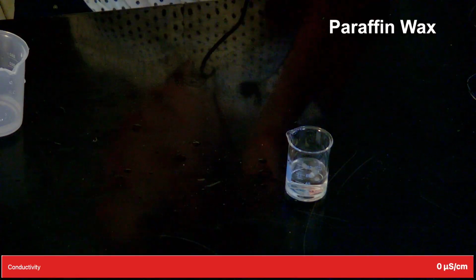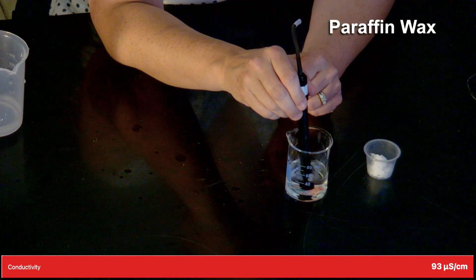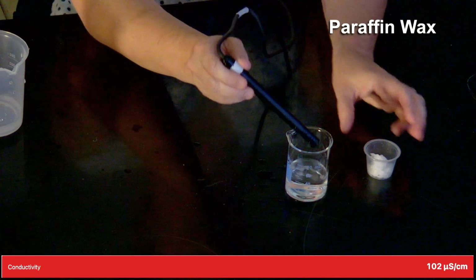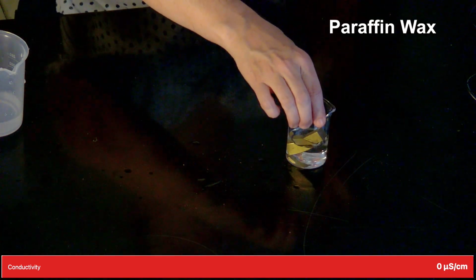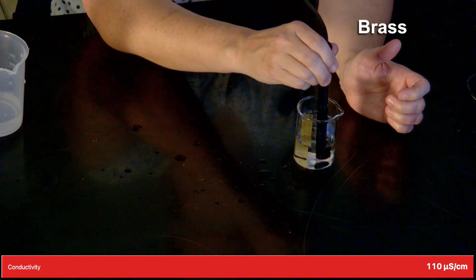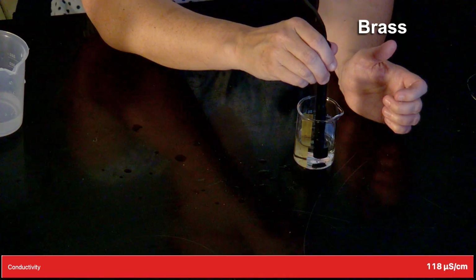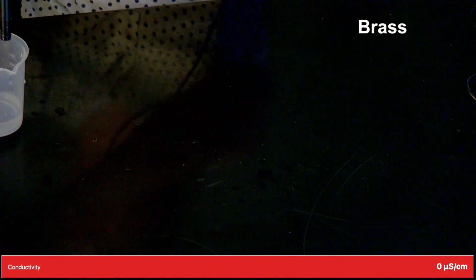And next we have paraffin wax. Then we have brass. And then we have nickel.